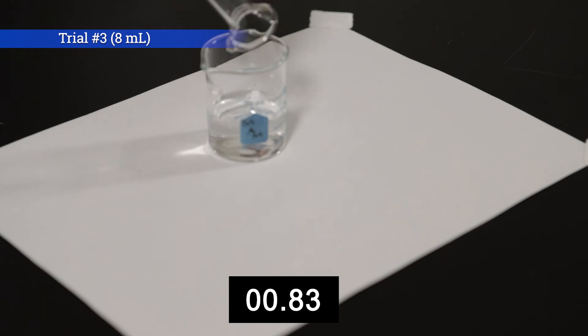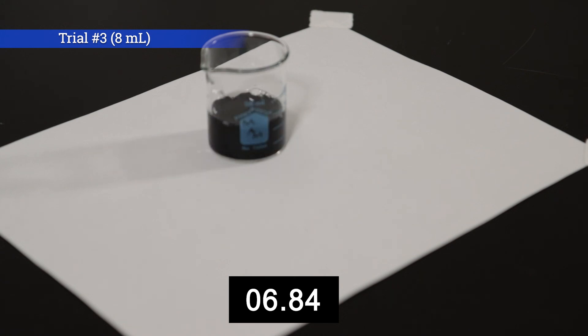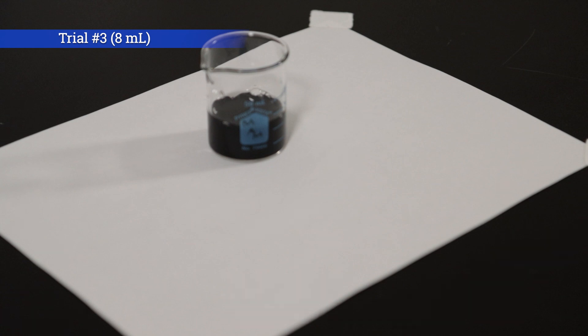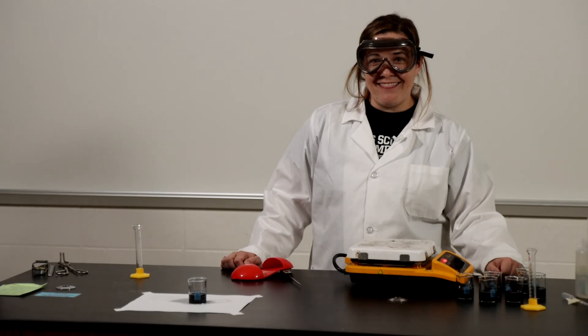Adding solution B. All right that is it for the iodine clock lab.